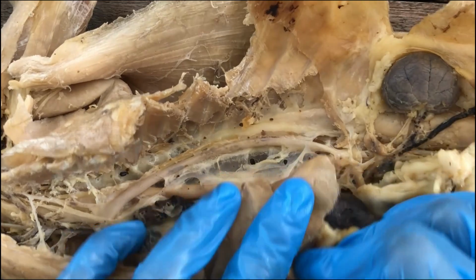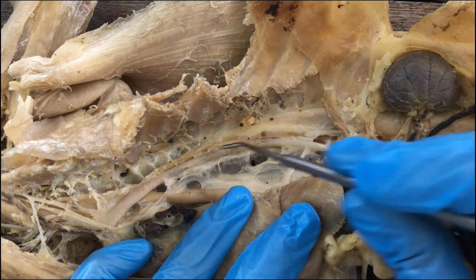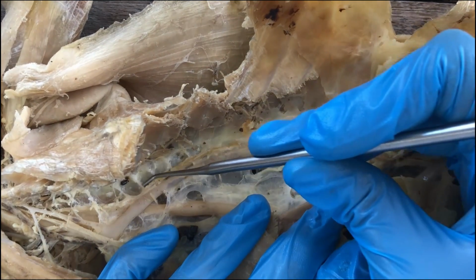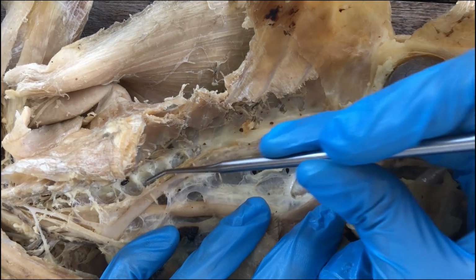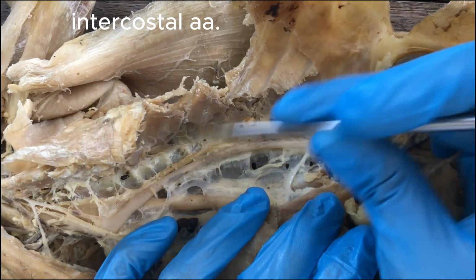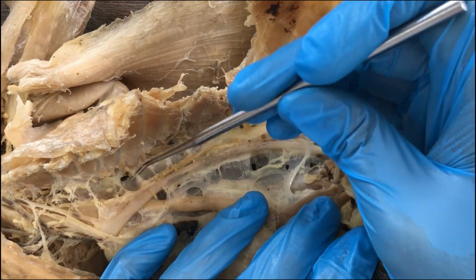Let's trace the thoracic aorta. So the thoracic aorta is this huge artery on the back side of the thorax, and you see that it gives rise to various intercostal arteries supplying the intercostal muscles of the rib cage, intercostal arteries.